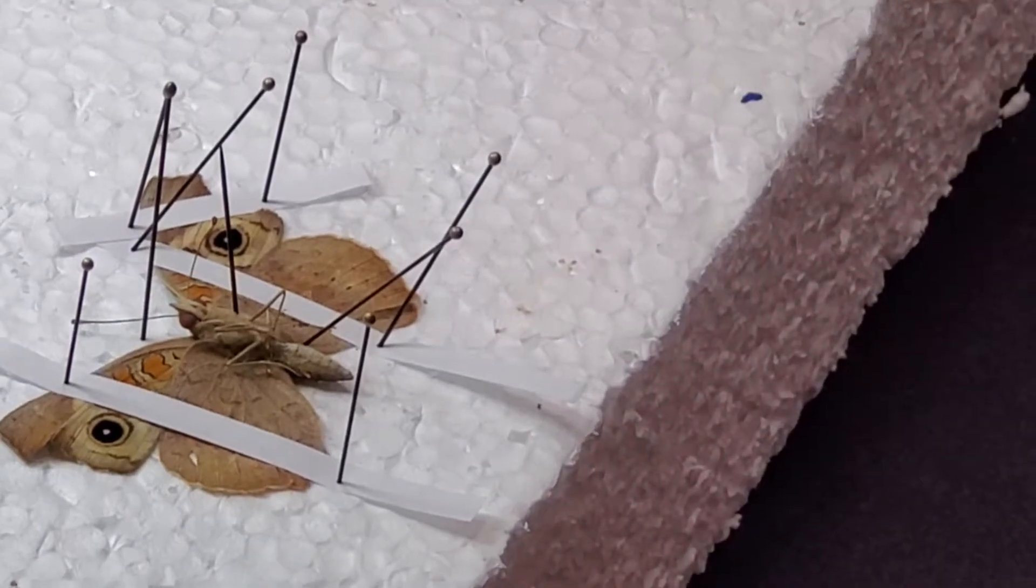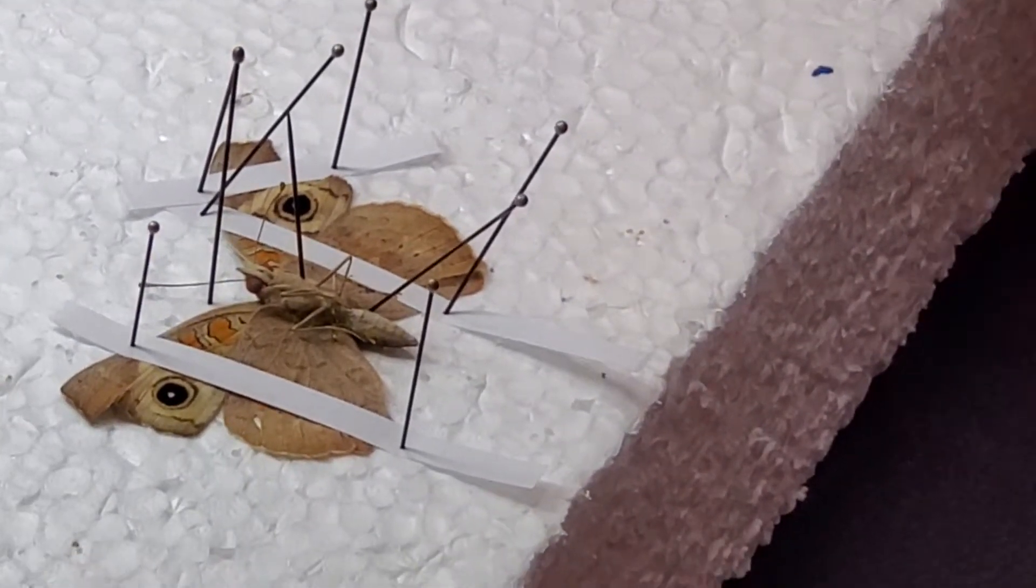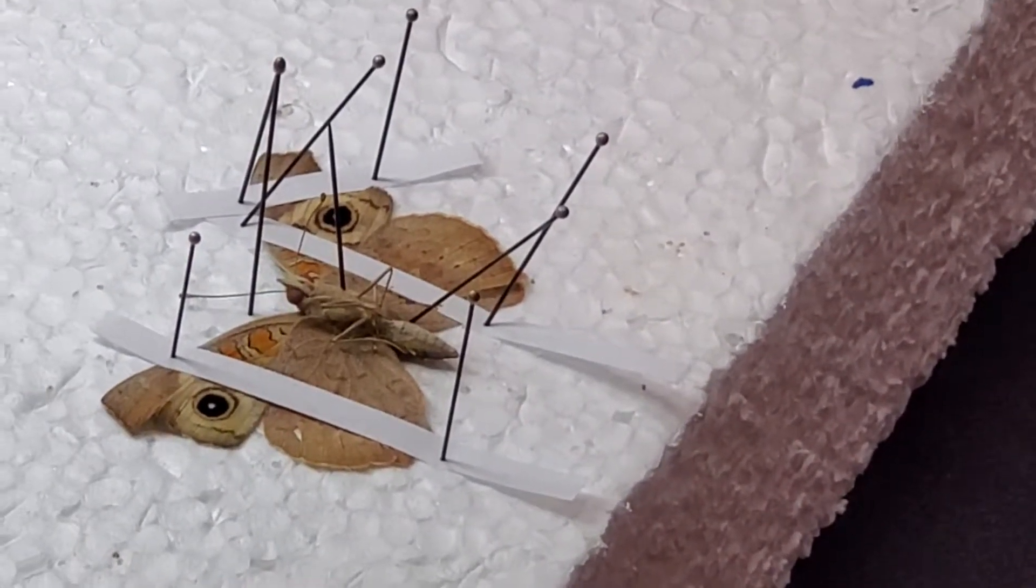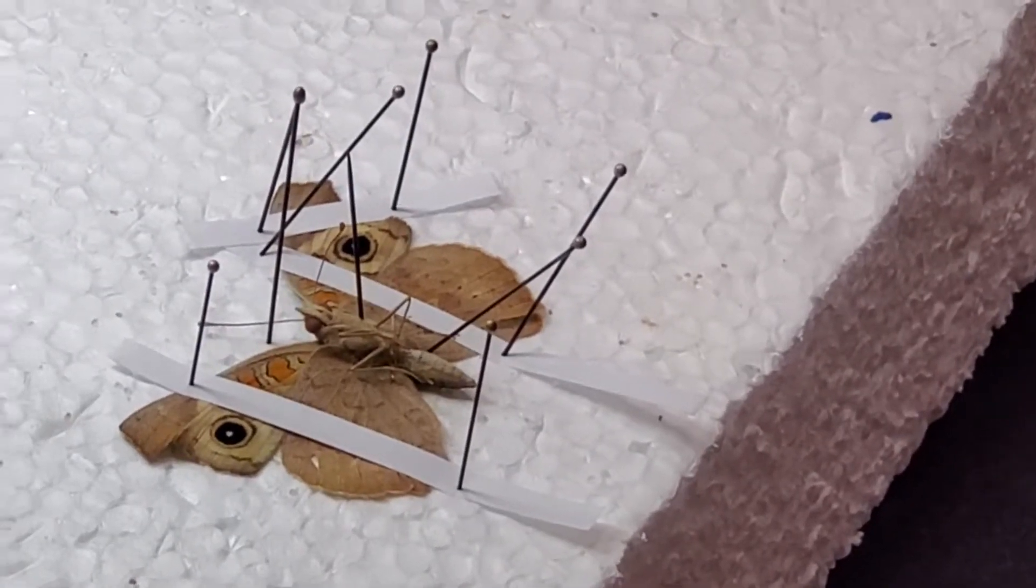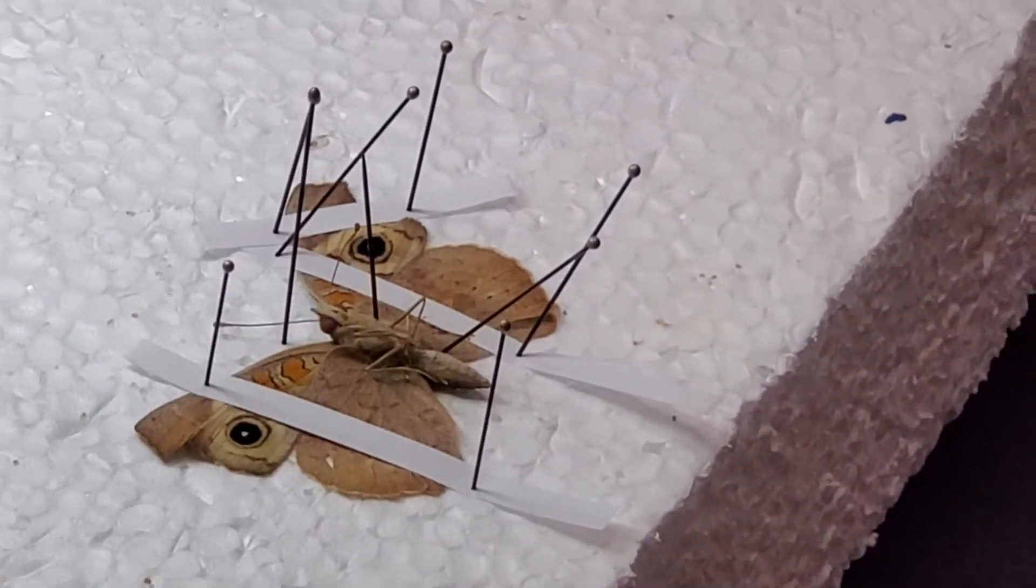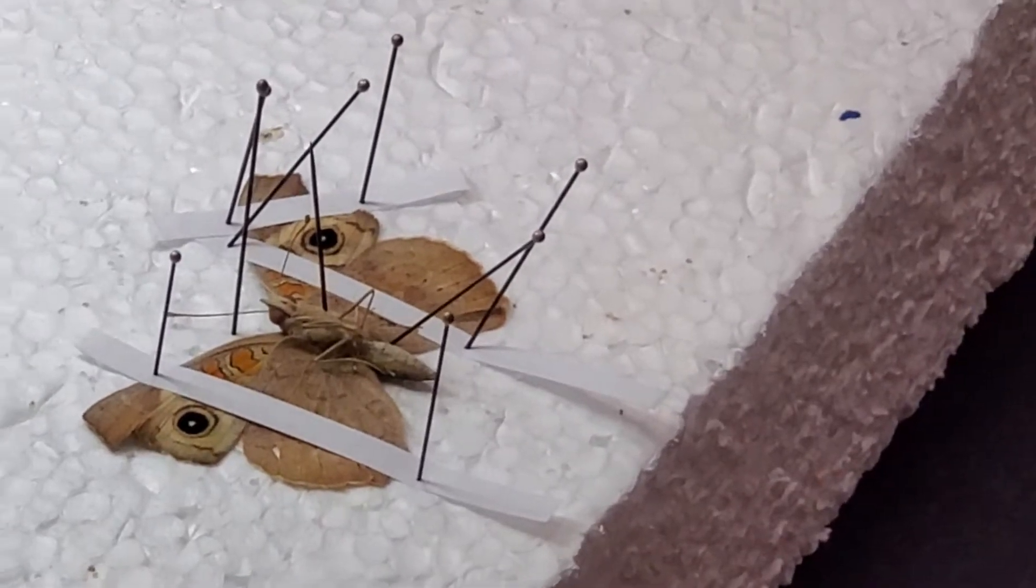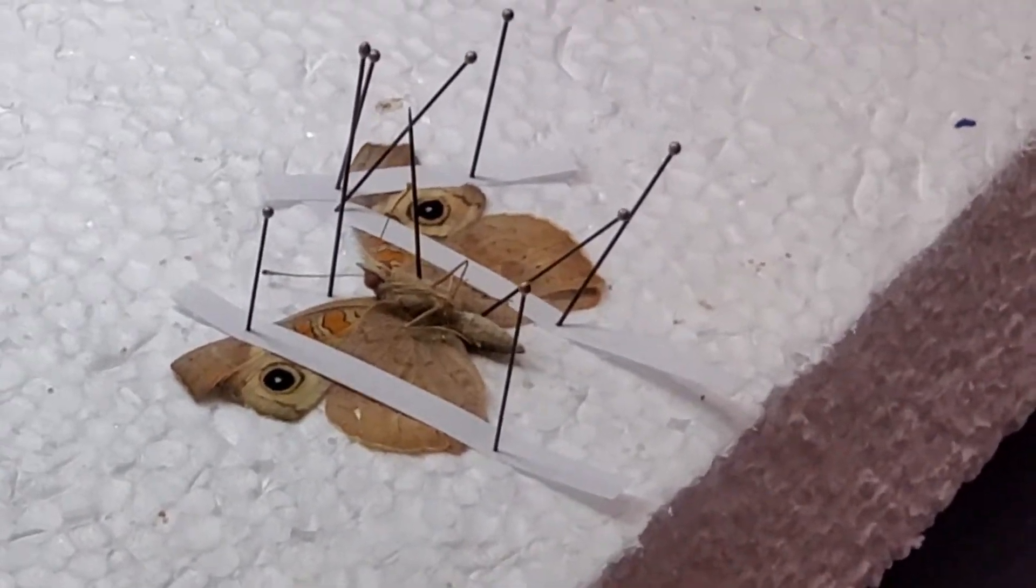Okay, the absolute minimum has now been finished. I'm reasonably happy. I will add a minimum of two more pieces of paper and I might add four more pieces of paper.